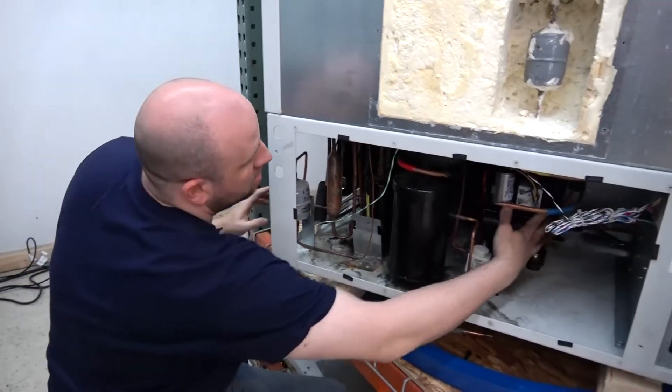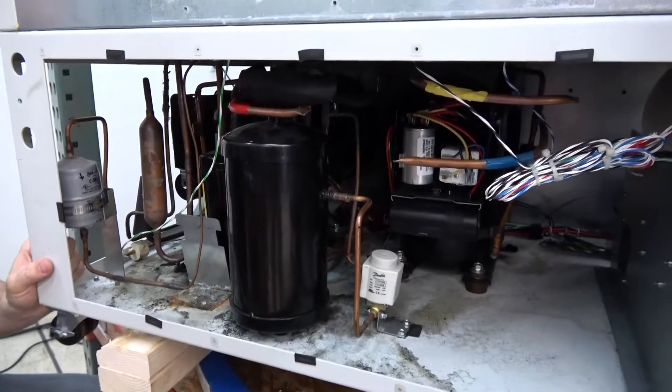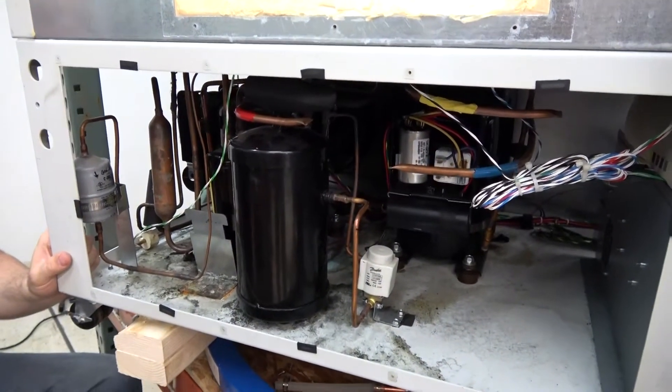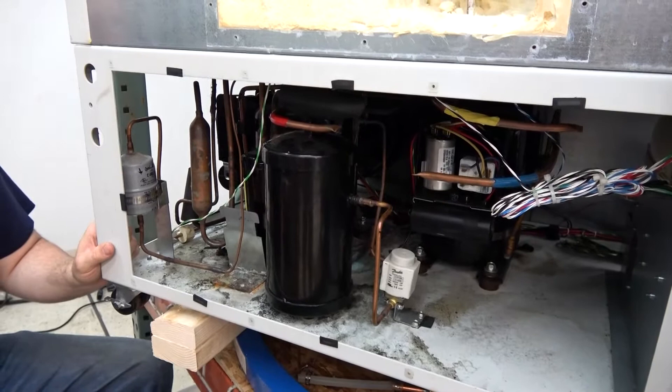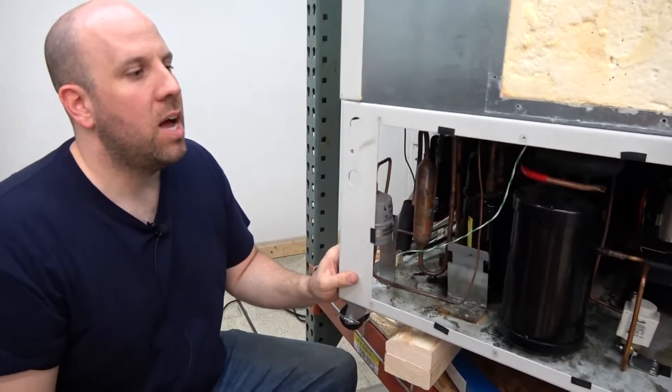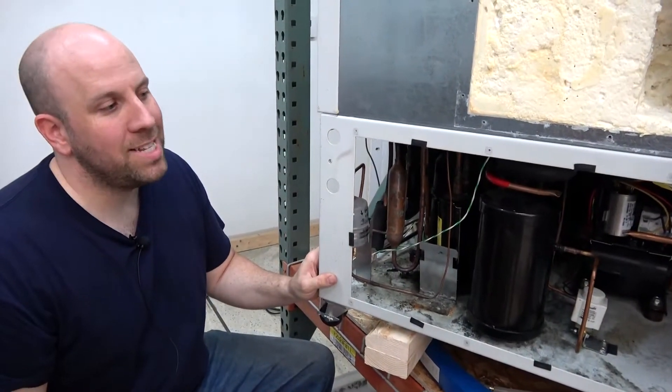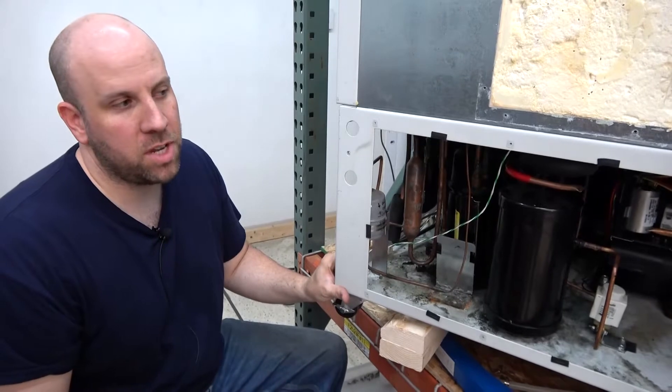You have the first stage and the second stage. Our experience has shown that first stage is not as picky and it tends to hold up longer than the second stage. The second stage reaches much lower temperatures, so it tends to have more problems than the first stage.